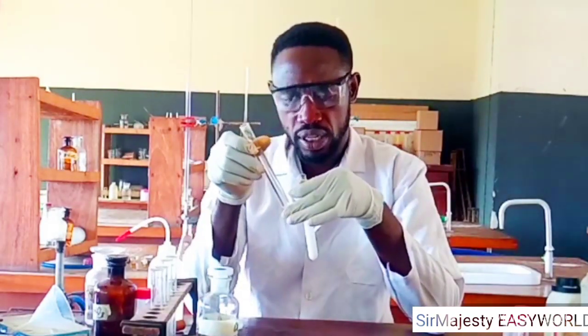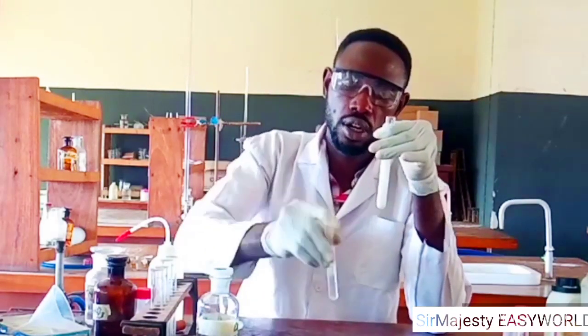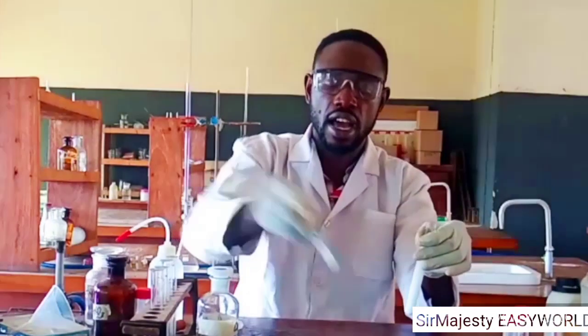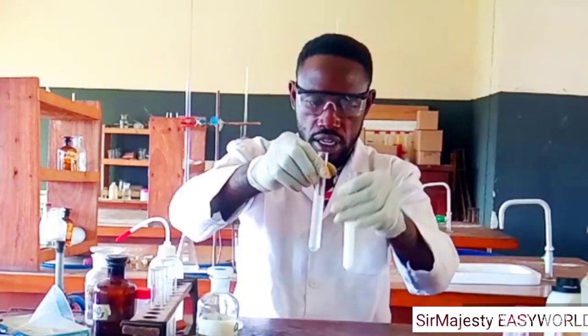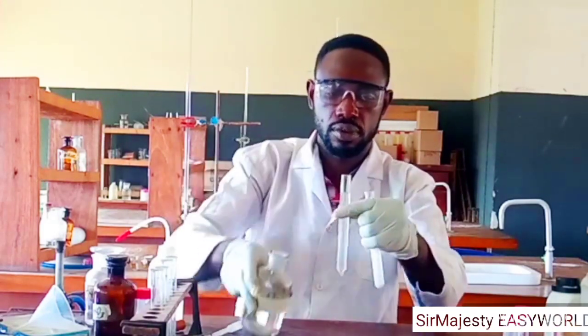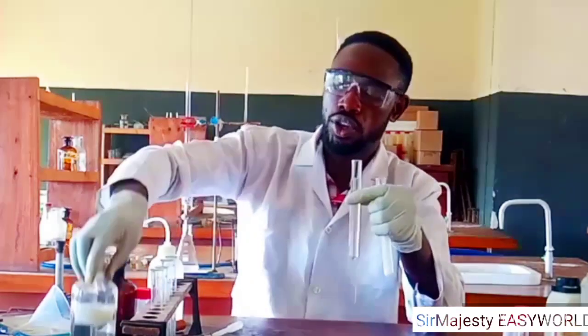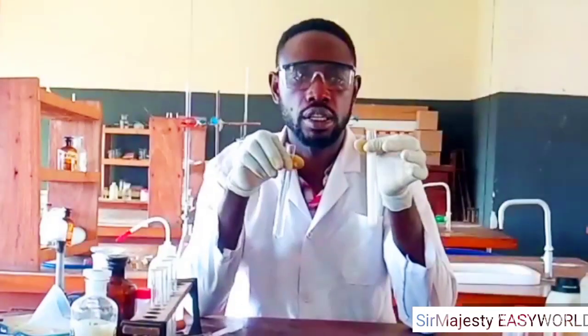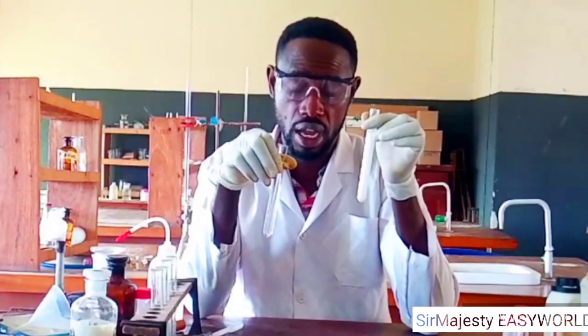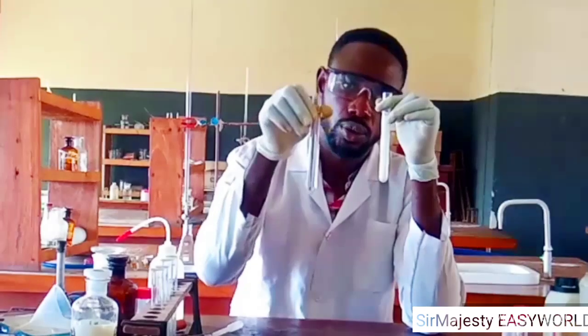Though from below here you might think it is persisting, it has dissolved. If you shake well, you find the solution becomes uniformly clear. It shows I have not added excess. If I add more base, it will be very, very clear. So no need of telling you this is dissolving and the other one is persisting. If you are told to do this with specimen E, which is calcium chloride, adding sodium hydroxide in drops gives a white powdery precipitate. If you add to lead nitrate, there will also be a white powdery precipitate. But in excess, calcium will persist, lead will dissolve.